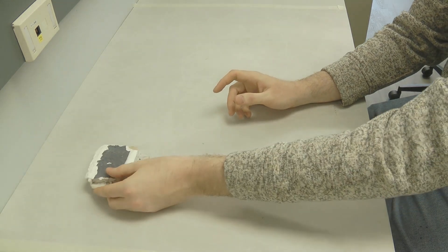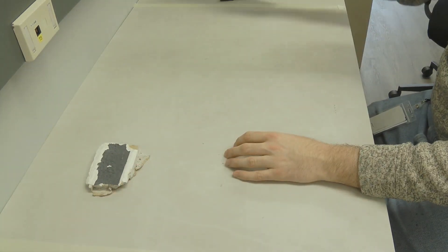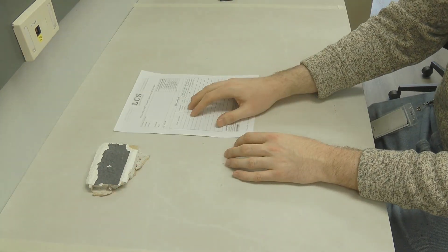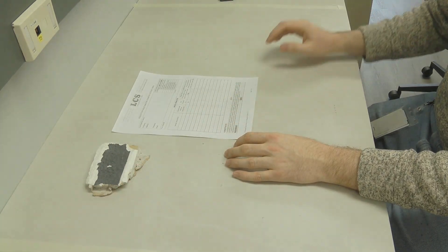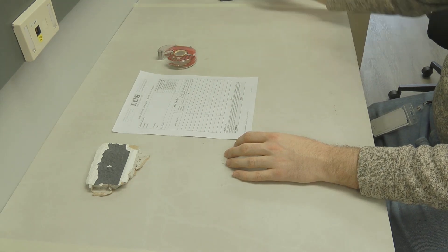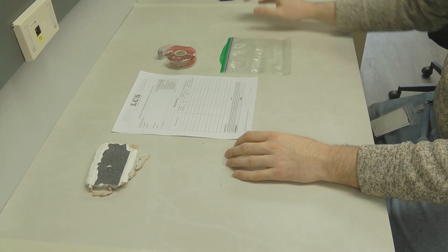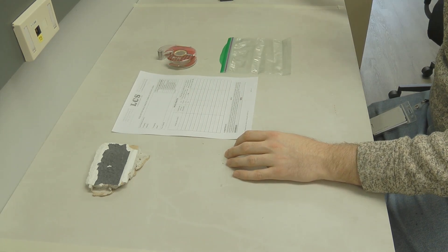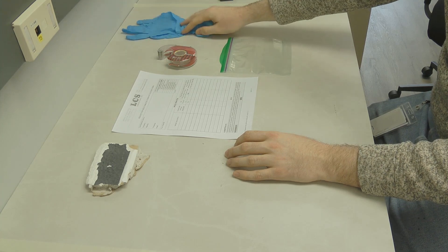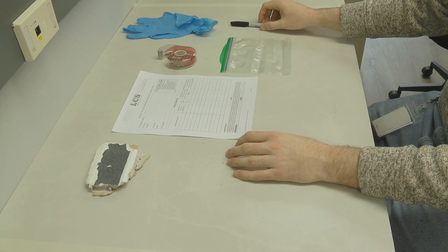LCS Laboratory and our very knowledgeable analysts are happy to test your sample, but it is very important that the sample you collect is of high quality. This technique is called the tape lift method and is used by scientists to collect a sample suitable for microscopic analysis.